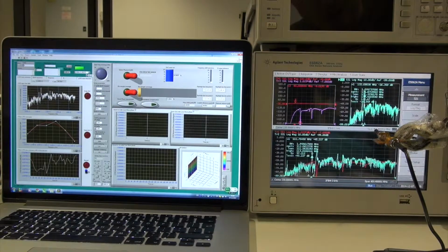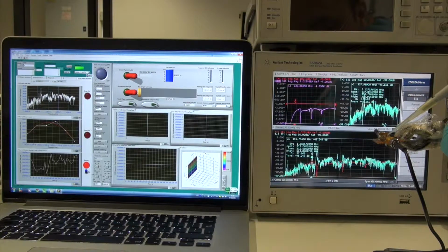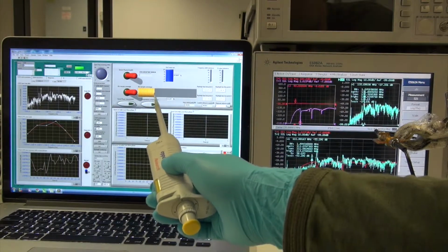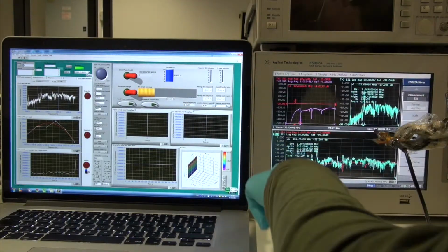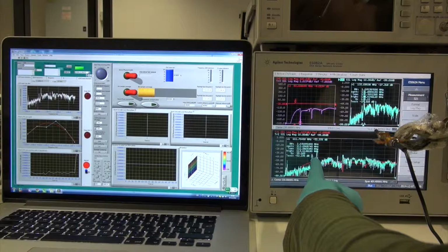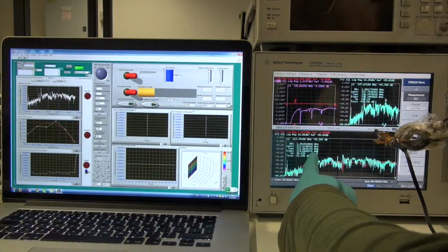For example, if I put a tiny drop on top of the surface in the propagation area, I put it on. You can see it tells us 28% of the surface has been covered, and you can also see the amplitude here. This first one is the Rayleigh wave resonance. The amplitude has been reduced to around 30% compared to the orange one.